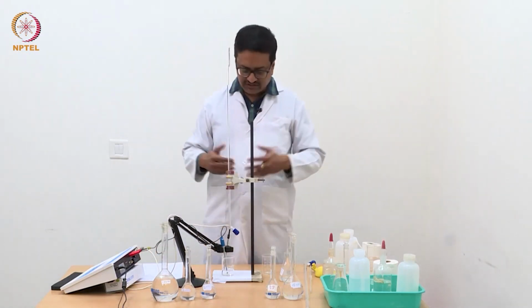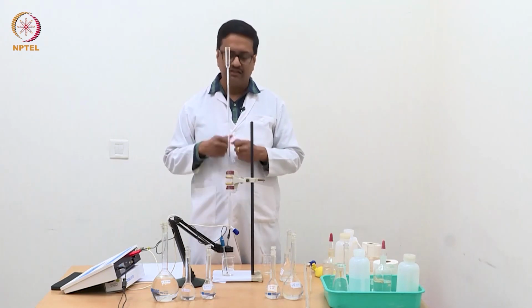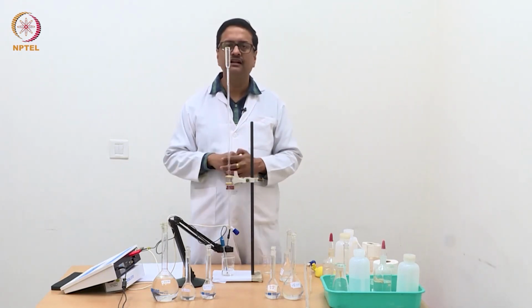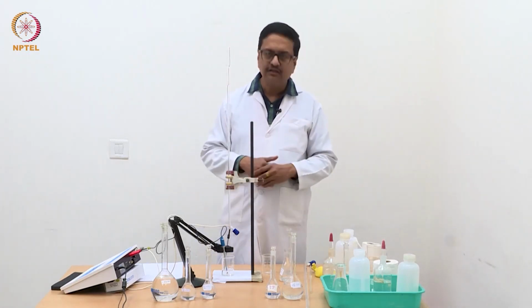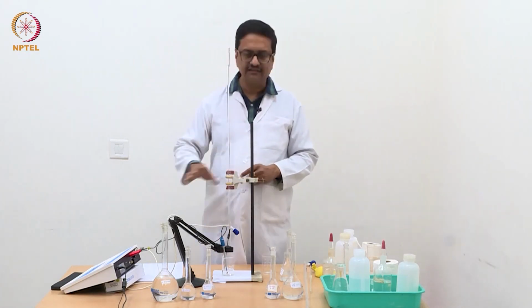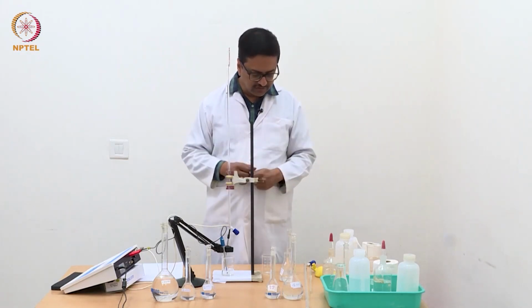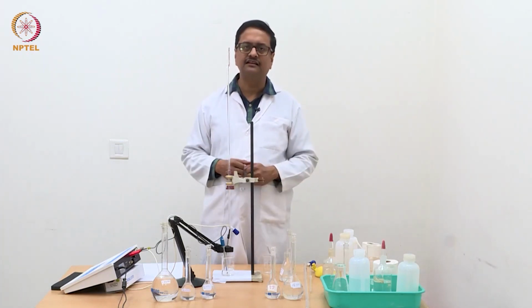So to start the experiment, we first need to remove this KCl solution, clean the electrode as before, and then add a little amount of water so that the electrode is dipped inside water and the conductance is read in microsiemens, and then we will add 10 ml of this unknown triple mixture and start the titration.